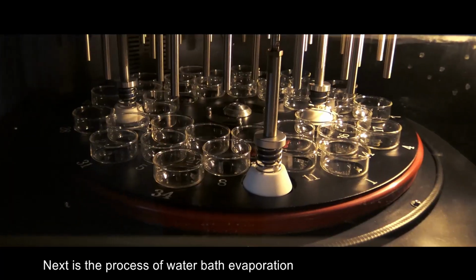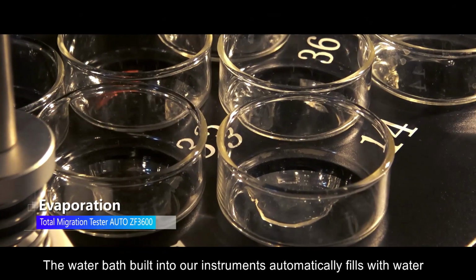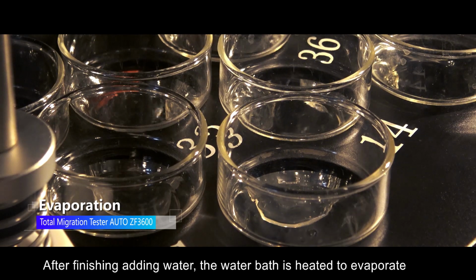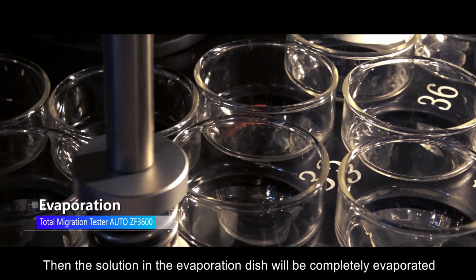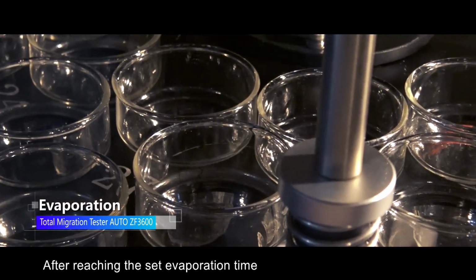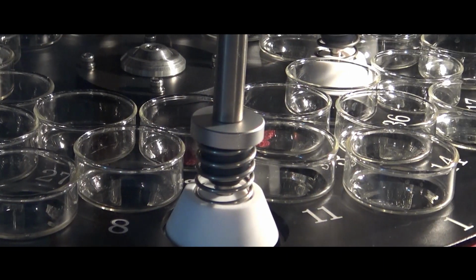Next is the water bath evaporation process. The water bath built into our instrument automatically fills with water and automatically senses the water level. After adding water, the water bath is heated to evaporate, and the solution in the evaporation dish will be completely evaporated. After reaching the set evaporation time, the next process is automatically executed.